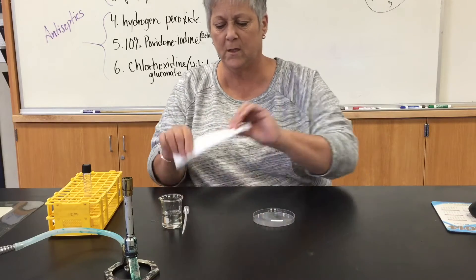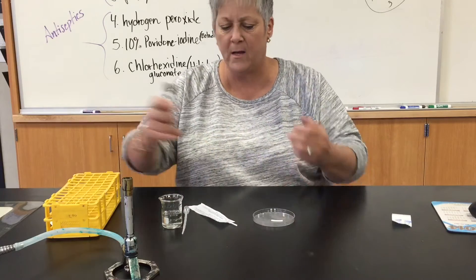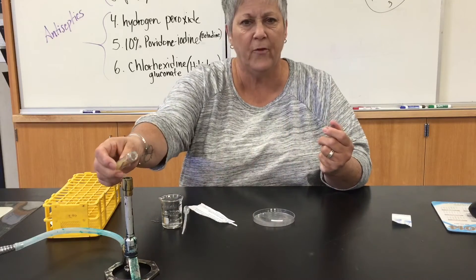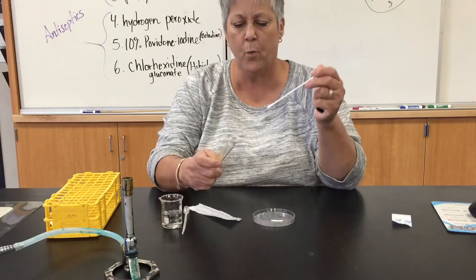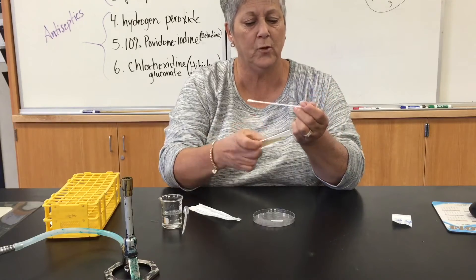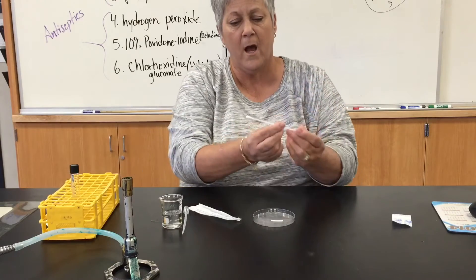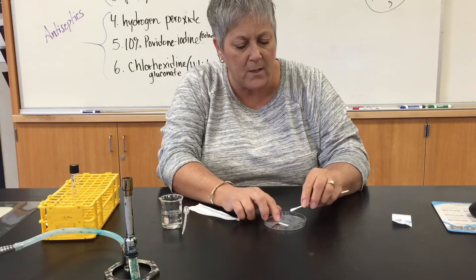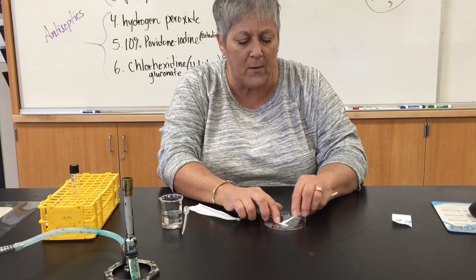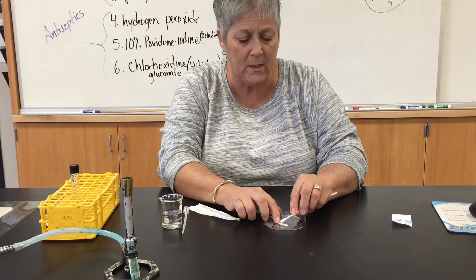Then what I would do is, I need a sterile swab for this test, so I'm going to open my package up. If there was really a microorganism on here, I would flame the lip of the tube, get my swab out, remove some of the organism from the slant, flame the lip of the tube again, replace the cap, and then I would hold onto the oxy strip with one gloved hand and rub the organism on the strip, and I'm looking for a reaction within 10 to 20 seconds.